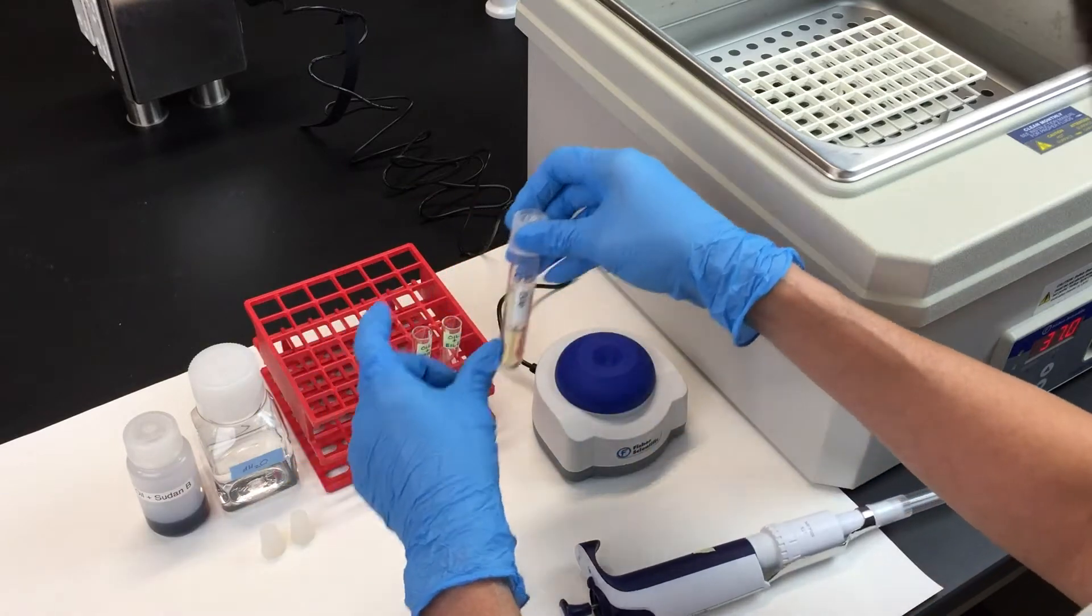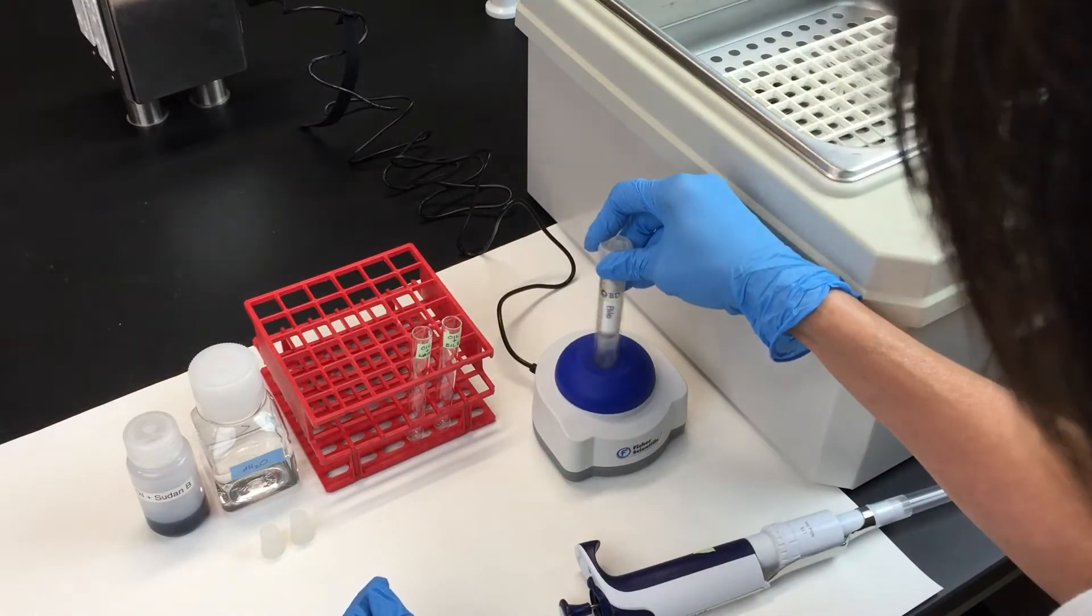Mix the bile and add four milliliters to the oil and bile test tube.